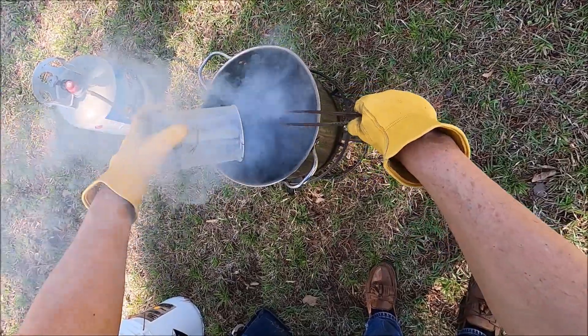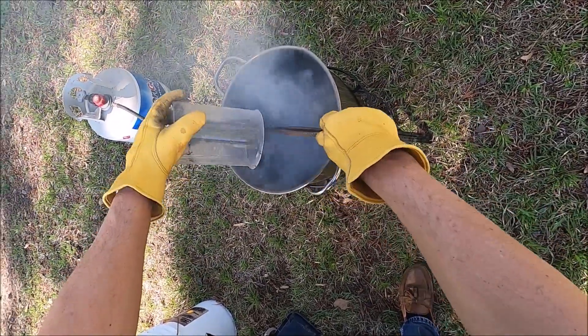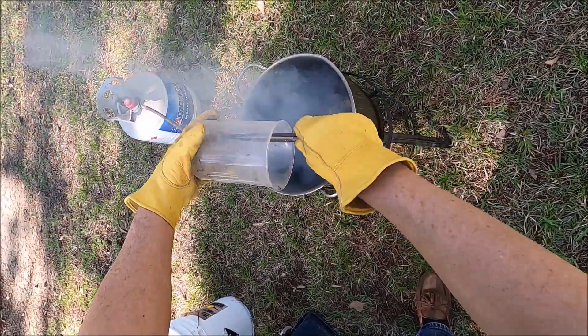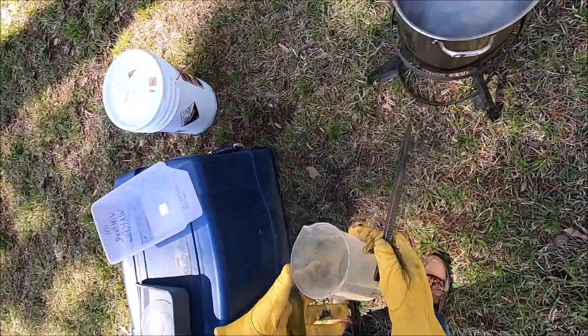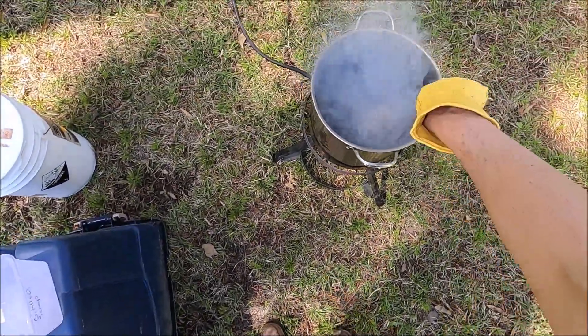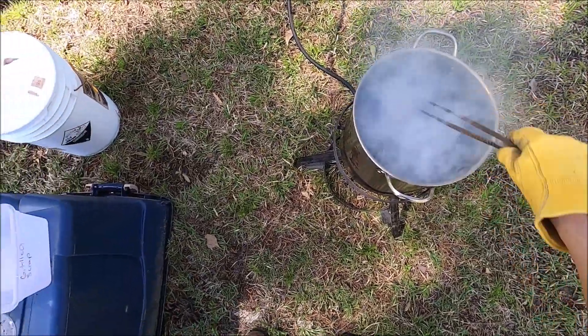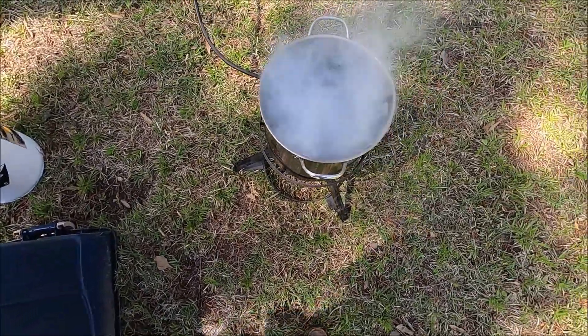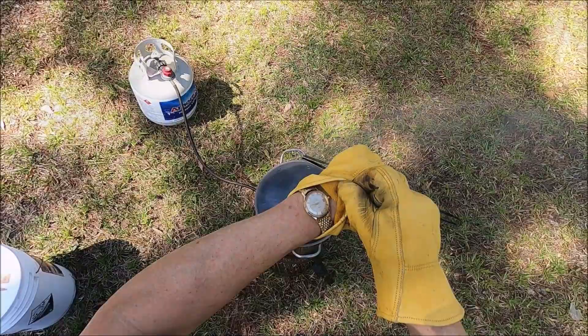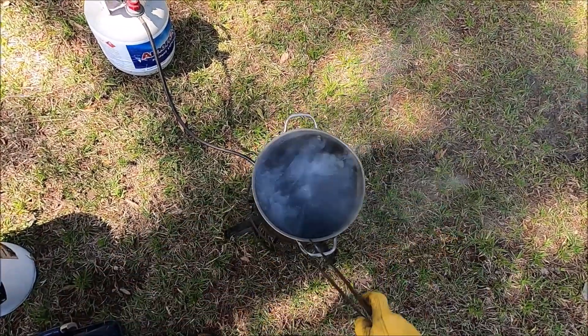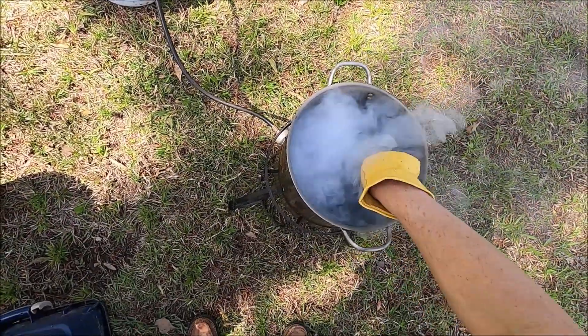Next I'm adding the material from the first time I changed out my fume hood way back in 2016. That beaker has been setting up on my shelf for four years. I'm not proud to say it, but at least we're gonna go ahead and get it processed in this video.